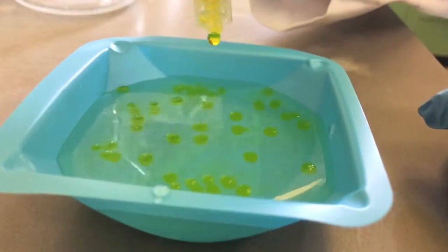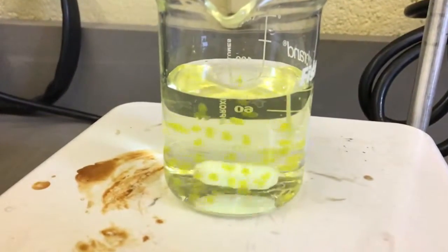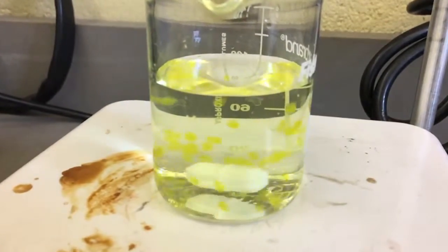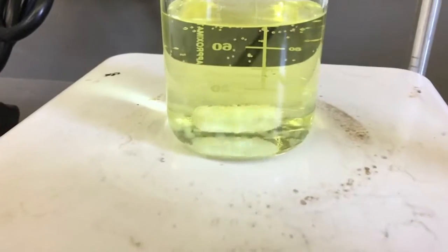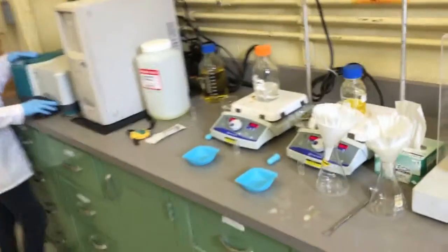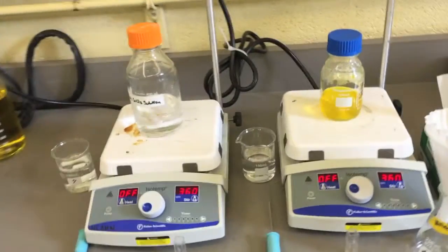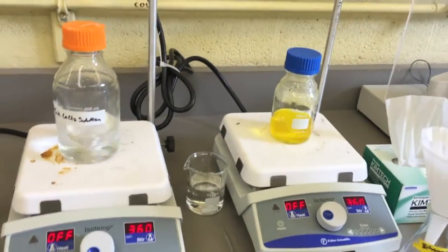Different factors may affect the rate at which a molecule diffuses out of a hydrogel. In this experiment, we tested bead size, mixing rate, and temperature as our variables. We will now briefly go over the procedure for this experiment. The first step of the procedure is to create the solutions.